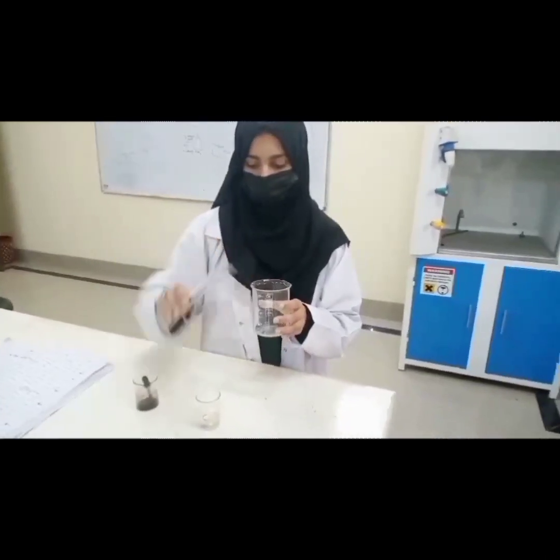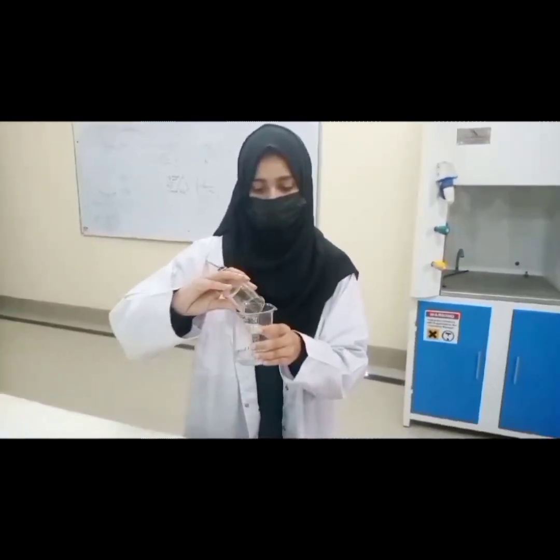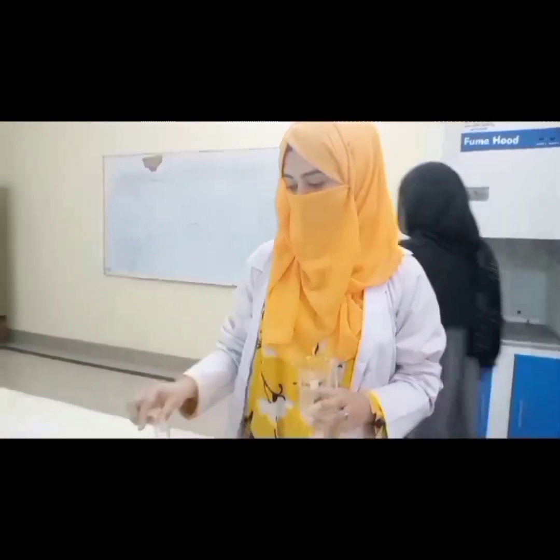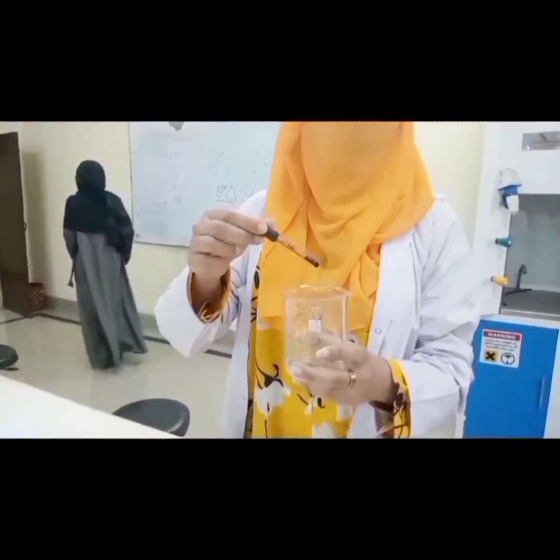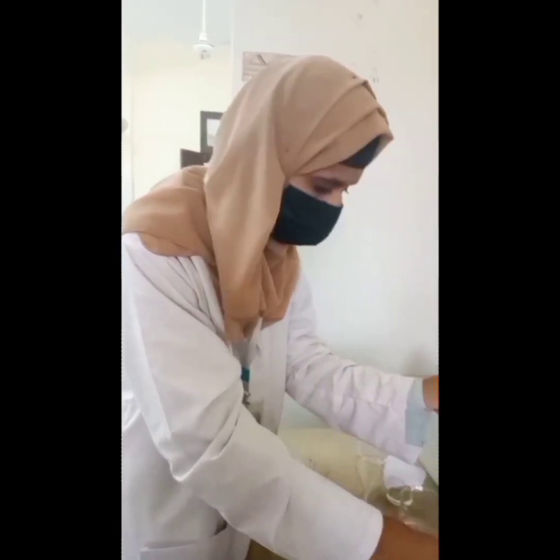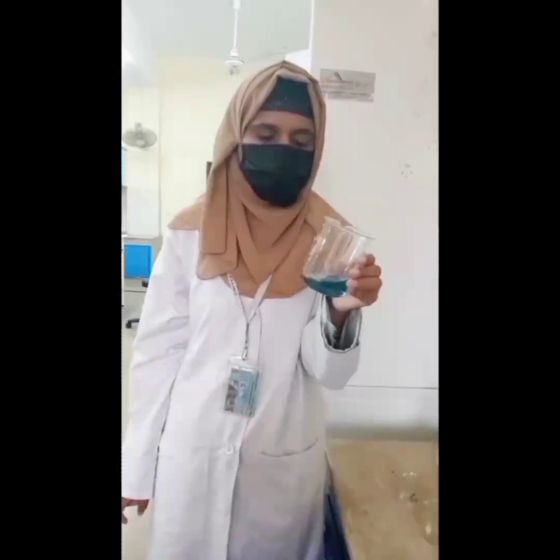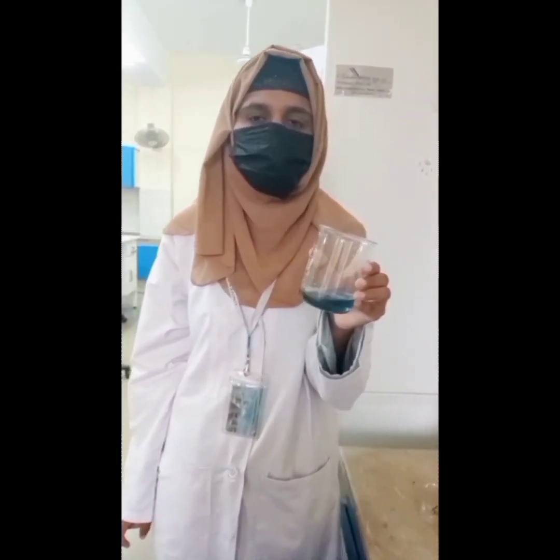Now we will take 20 ml of boiled water and add buffer solution, which is ammonia buffer whose pH range is 9 to 10. Before performing the titration, gently shake the solution before adding 2 to 3 drops of EBT indicator. Now we will add 3 drops of EBT indicator. Again we will perform the titration against EDTA, which is taken in the burette, and after performing the titration the color of the solution turns to blue, and the reading of the consumed EDTA is noted carefully again.